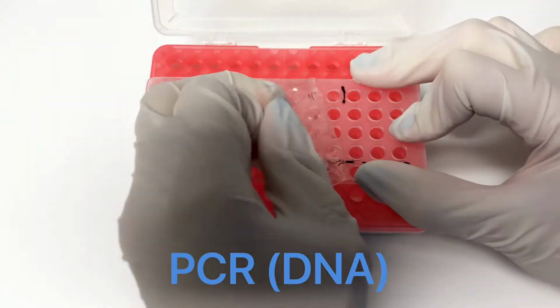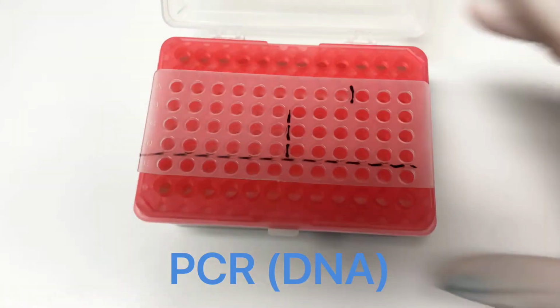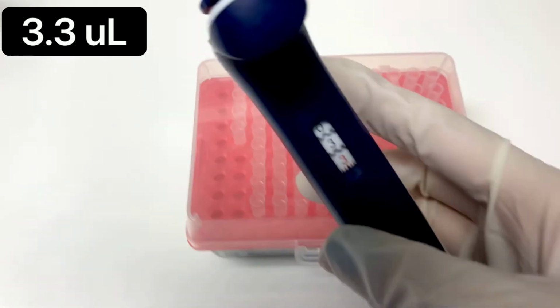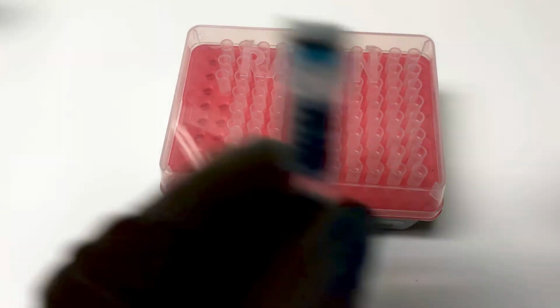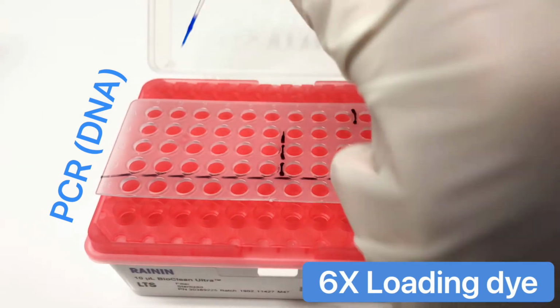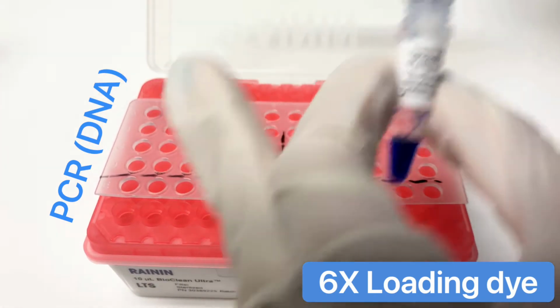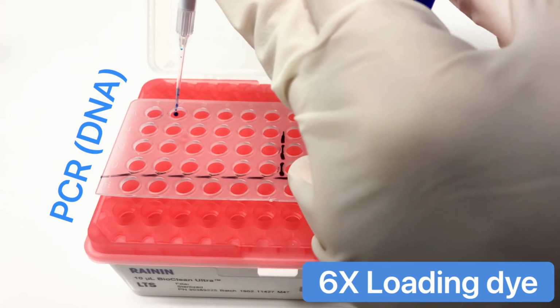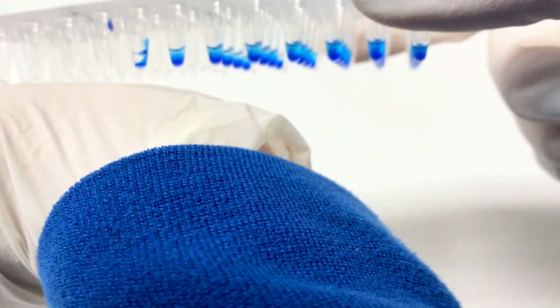Carefully remove the plastic film from your PCR plate. Set a pipette to 3.3 microliters. Now we are going to add the 6x loading dye to our PCR product. You may use the same pipette tip if you do not touch the wells. If the dye does not reach the sample, you may tap lightly to mix.